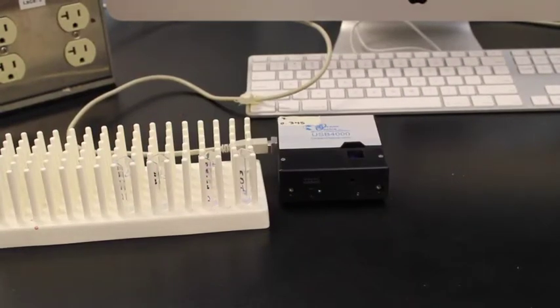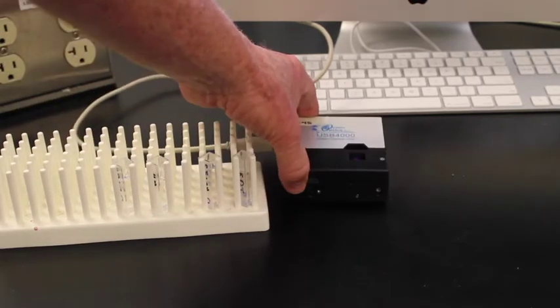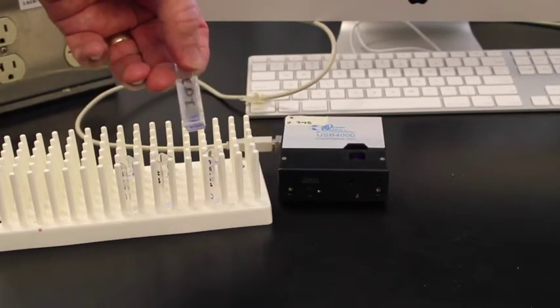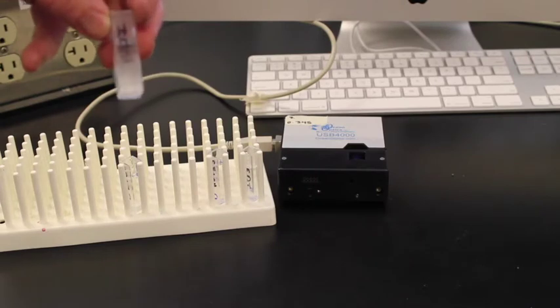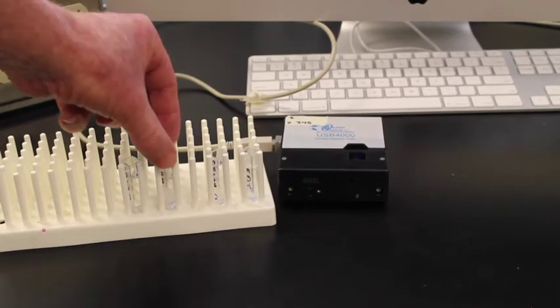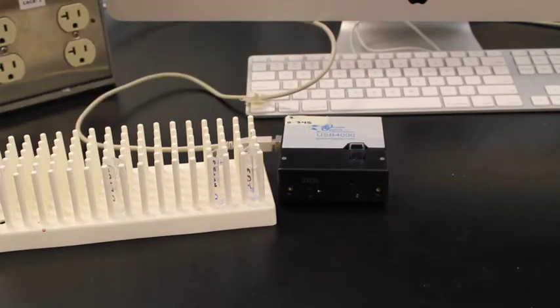Now that we have our solutions in our cuvettes, we can take the cuvettes and use a spec to measure the absorbance. So here's our spectrometer. It's hooked up to the computer with this cord. We have the experimental DI solution, which is onion in DI water. The other is called BDI or blank DI, which is just straight DI water. I'm going to start by taking the blank water, putting it into the spectrometer to calibrate the spectrometer.